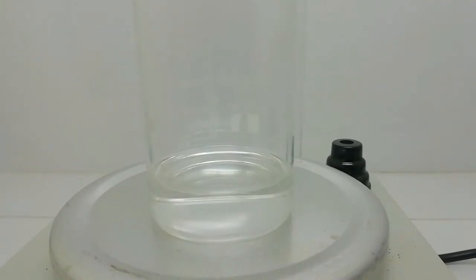First we need concentrated hydrochloric acid. I have taken about 20 milliliters of concentrated hydrochloric acid. Now I am going to show you the reaction first. Here I am going to add a little piece of nickel metal into this hydrochloric acid.